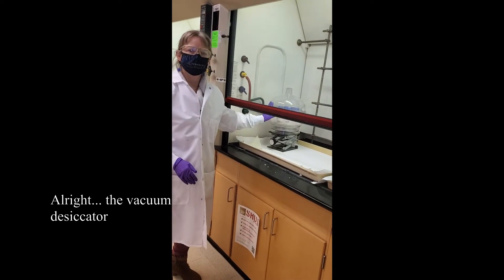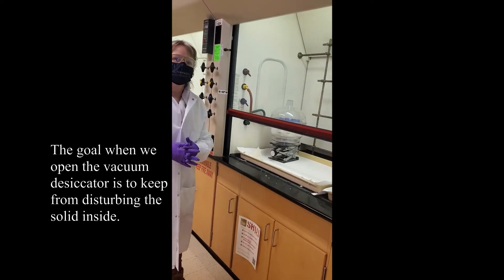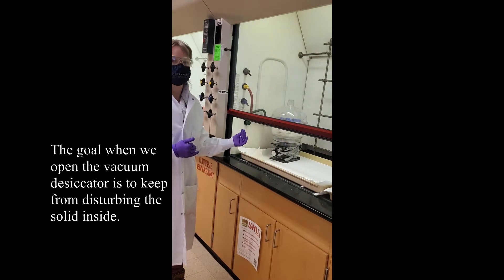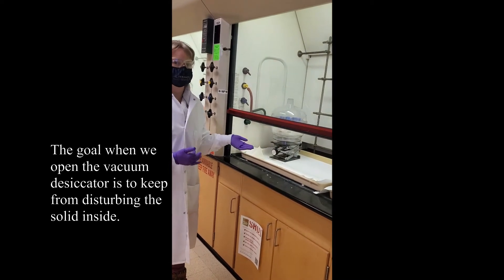All right, vacuum desiccator. The goal when we open the vacuum desiccator is to keep from disturbing the solid inside.